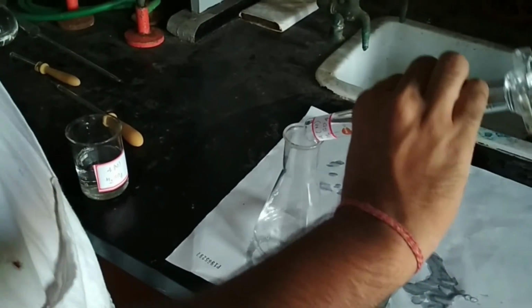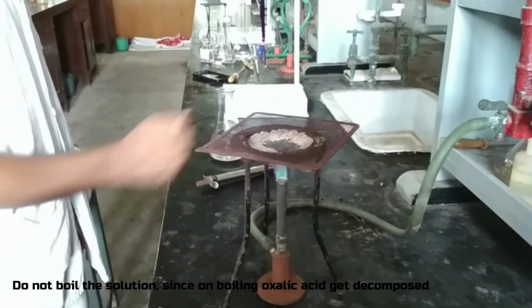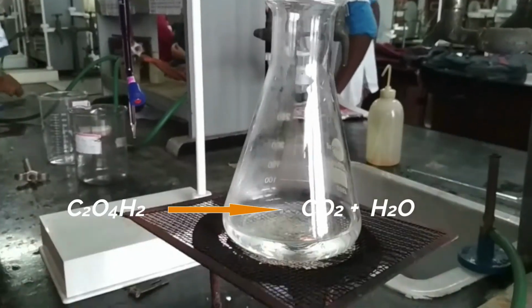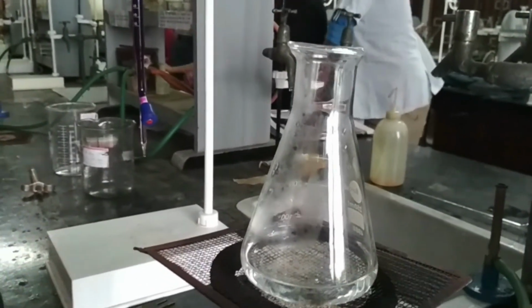Why do we not heat the solution at 100 degrees centigrade or boil the solution? Why do we maintain the temperature between 70 to 80 degrees centigrade? Because when we boil the solution of oxalic acid and H2SO4 mixture, oxalic acid gets decomposed and carbon dioxide and water are released. So again the titration result is erroneous.